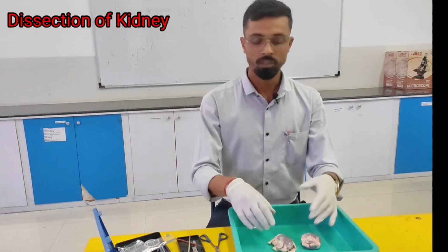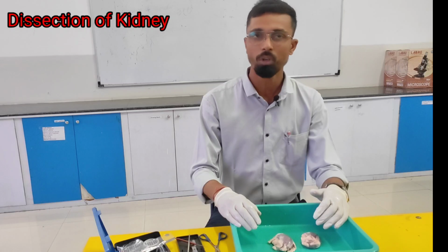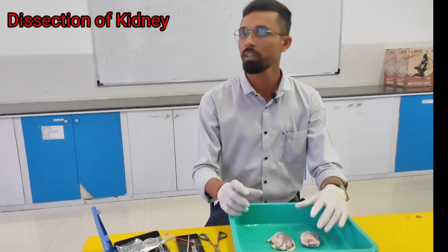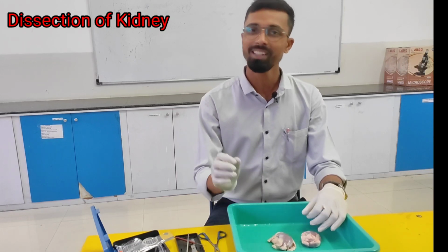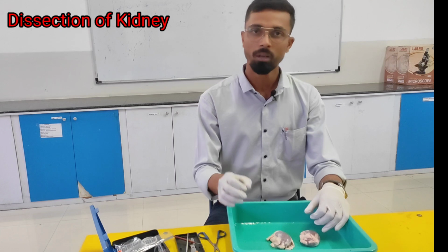Hello students, in this video we will see about the excretory system organ. As we all know, the main excretory organ in our body or an animal is what? It's the kidney, which basically functions to filter the blood.